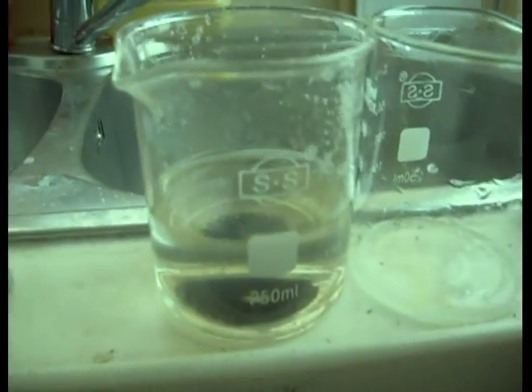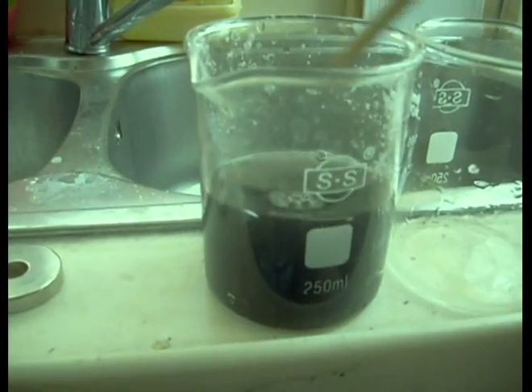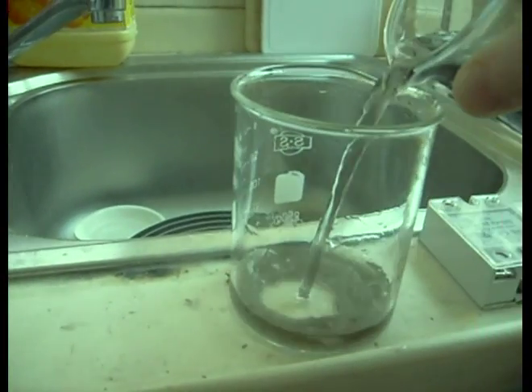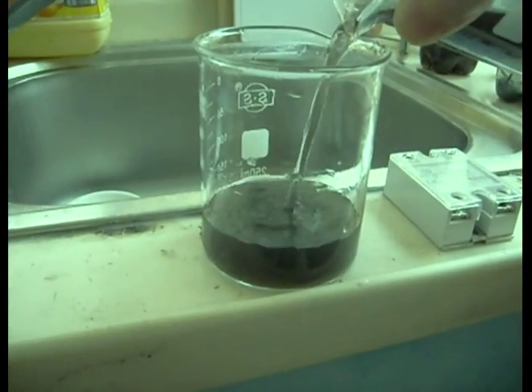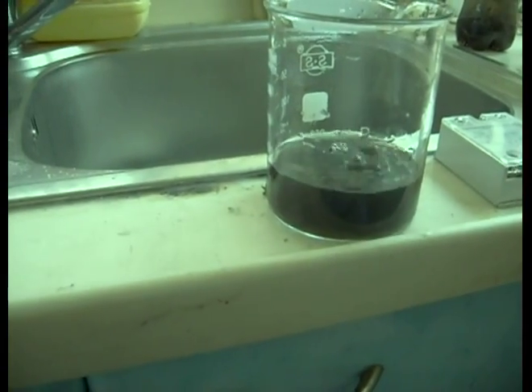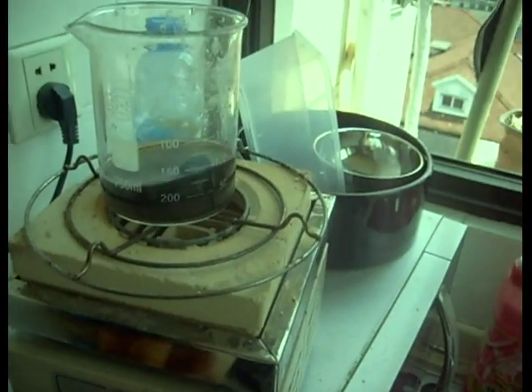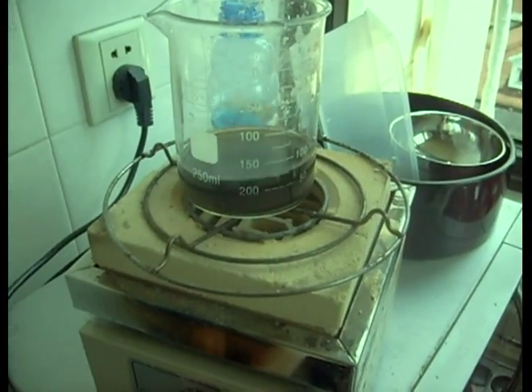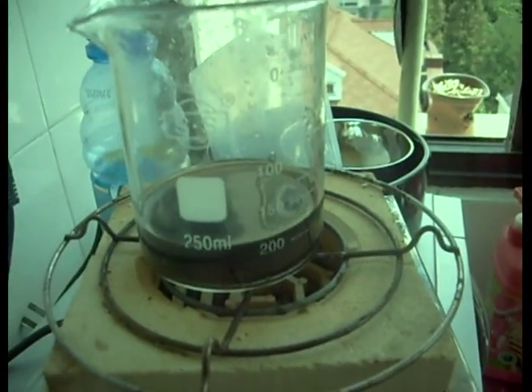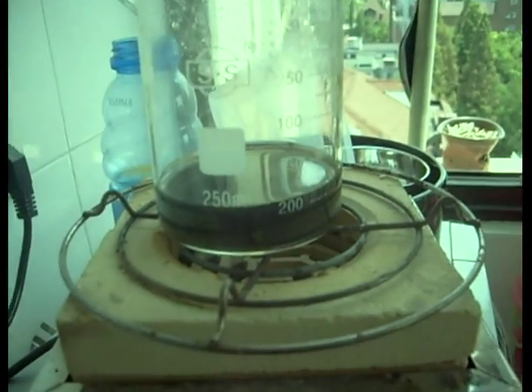Let's take off the magnet and mix her up. I'm going to try three various things. I'm going to get rid of some of this and take a small amount, and we're going to boil her down. Then we're going to see what we get with a higher concentration. Last time we did a much lighter concentration — this time we should get some darker crystals.